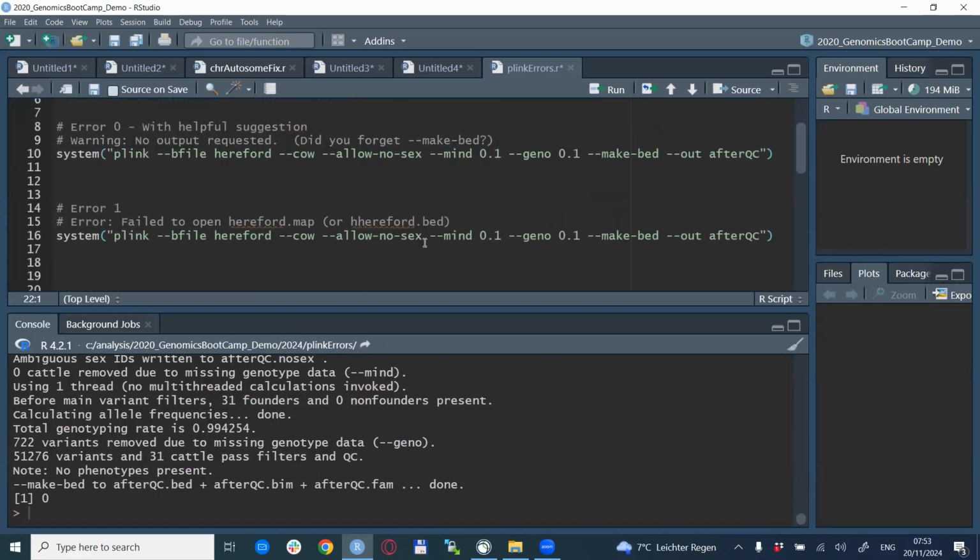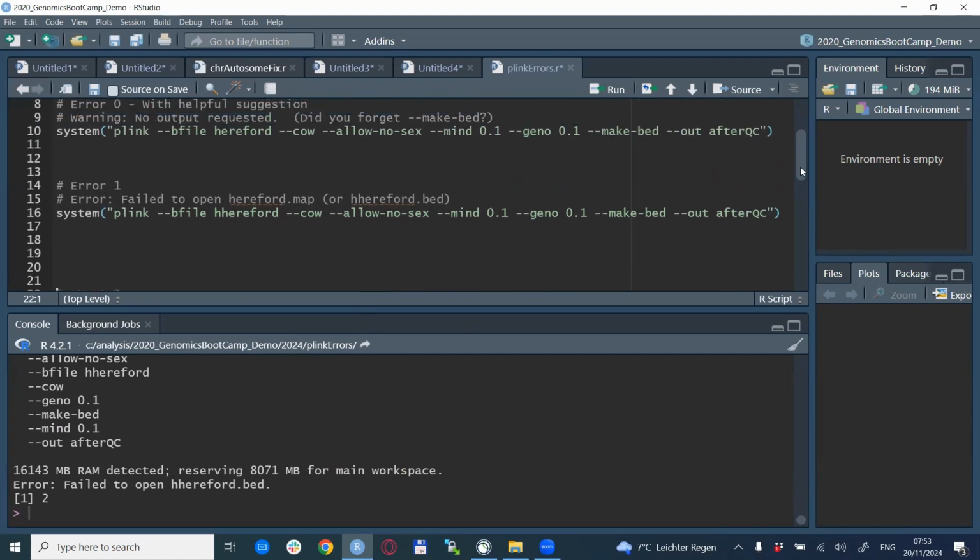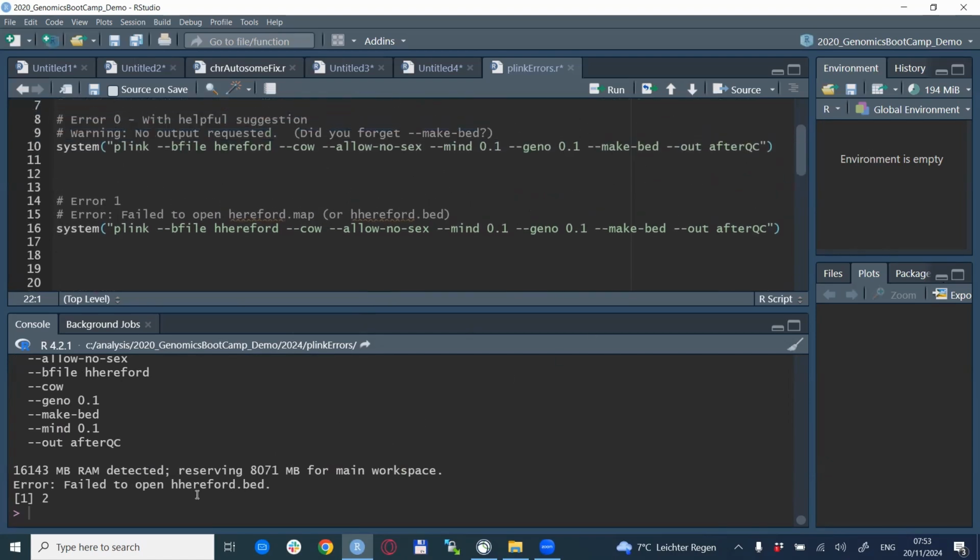Actually, the same thing happens if you make a typo in the file name. In this case, I just made up a little typo here, but of course any other typo does the same thing. If you run it here, it looks for the bed file, so correctly for the binary PED file format. But since it's a wrong name, it couldn't find it and couldn't start. So be sure that the files are there where you are looking for them, that they are in the correct format, and also that they are written in a correct way.